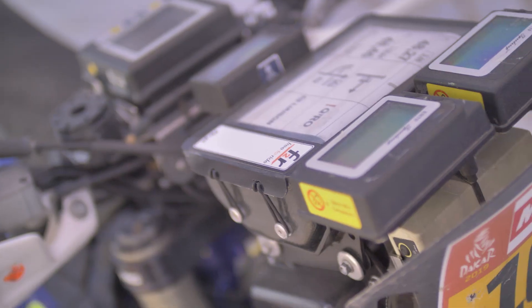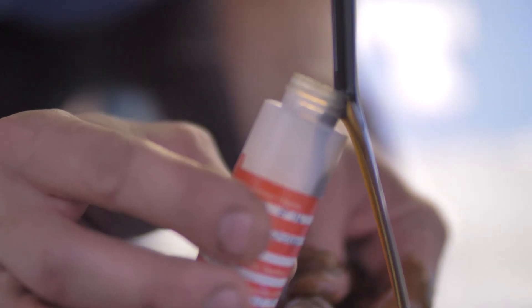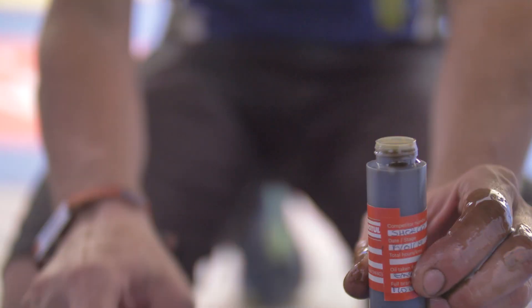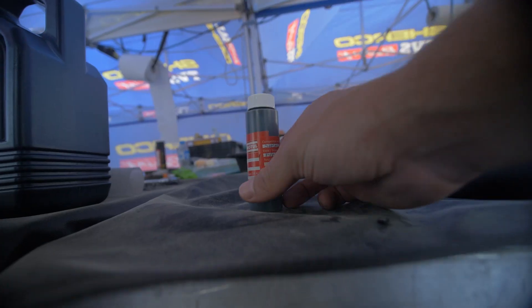So it all starts with a used oil sample. This one has just been drained off the Sherco bike that just won stage 9 of the Dakar. So let's see how the oil behaves in that engine.